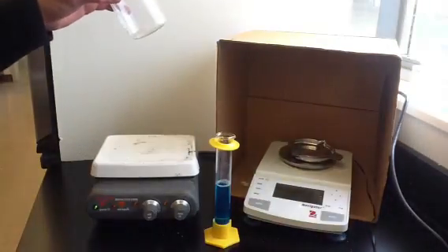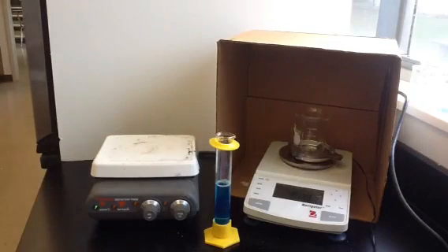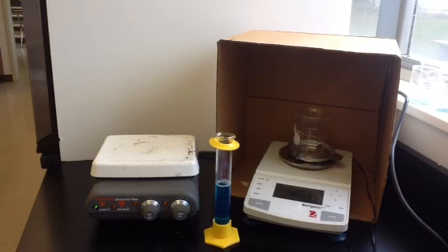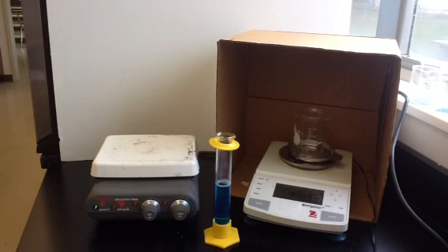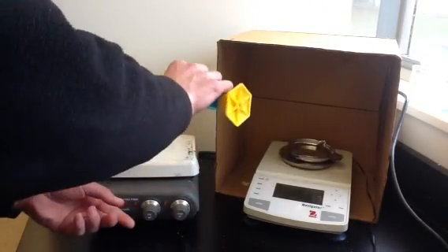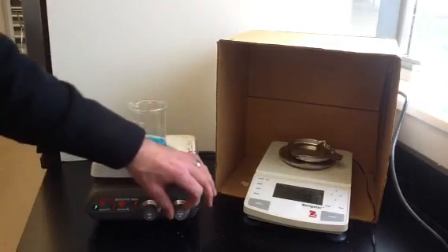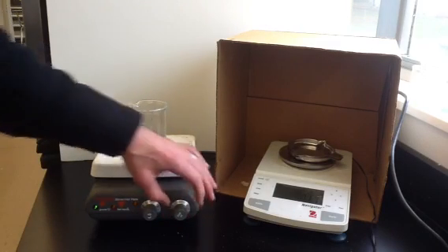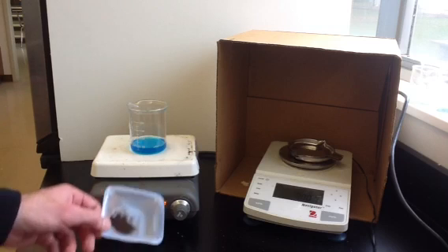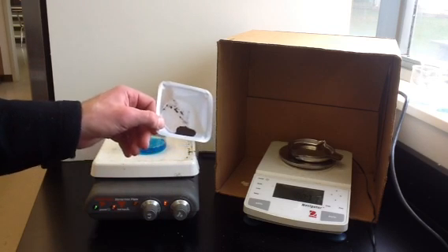These are iron filings, and I measured out 1.00 grams of iron filings. We're going to weigh this empty beaker. The mass of our empty beaker is 94.83 grams. Now we're going to take some copper sulfate and heat it on the hot plate. We have already measured out 1.00 grams of iron.